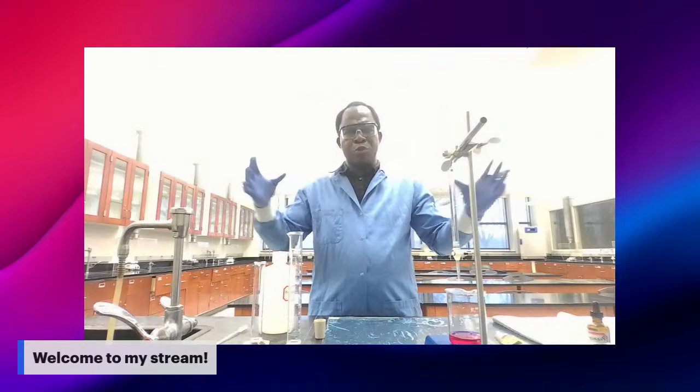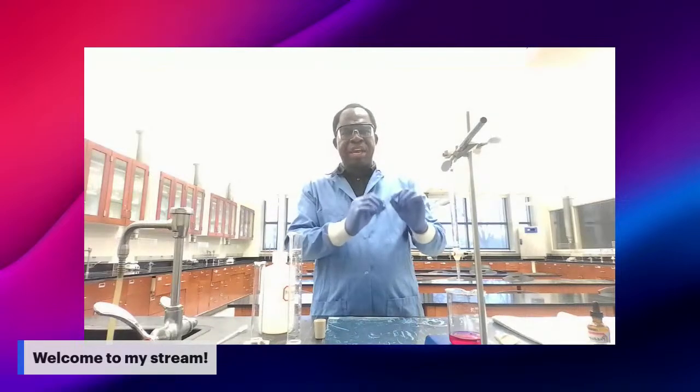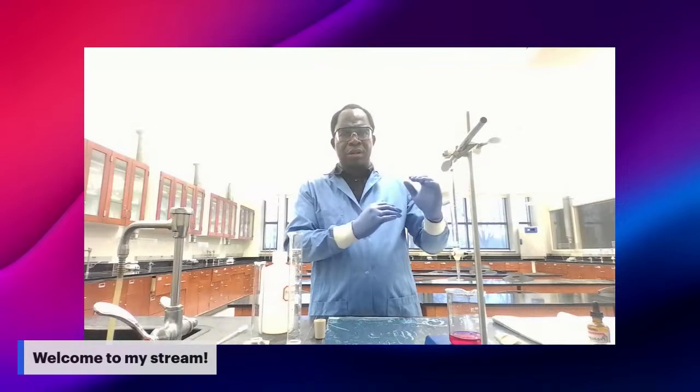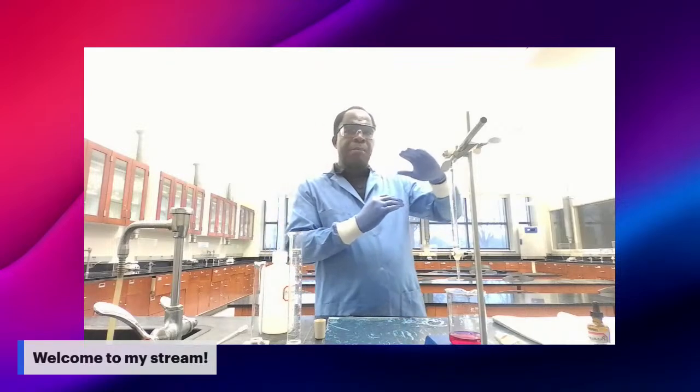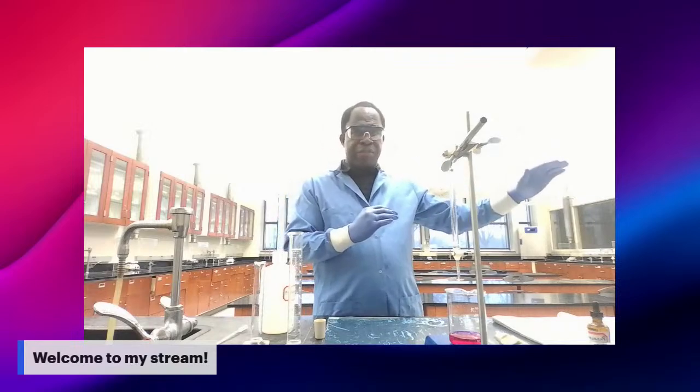It's not too big. The change in the pH is very small. This is telling you that you are on the plateau region of your graph.